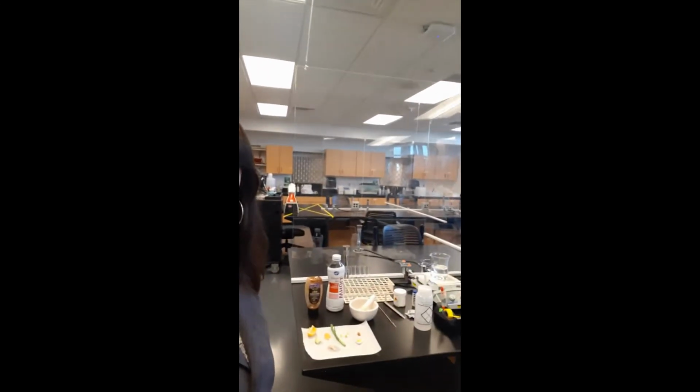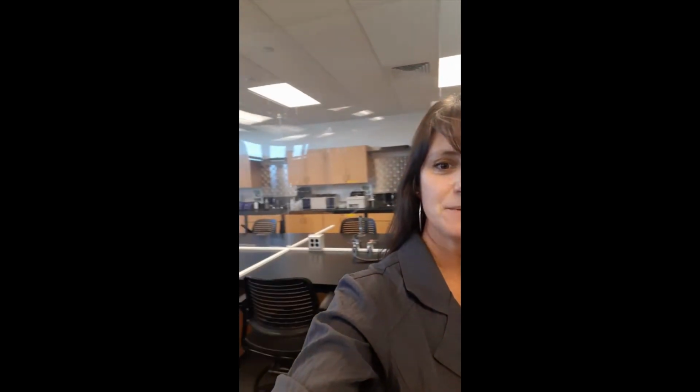Hello, Bio 100C or Bio 100L, and we are here today in the lab to work on sampling and testing for proteins. We'll be doing this by sampling various foods. We're here in the lab, which is a special treat these days. So I'll just show you around a little bit. As you can see, I have my materials all together.